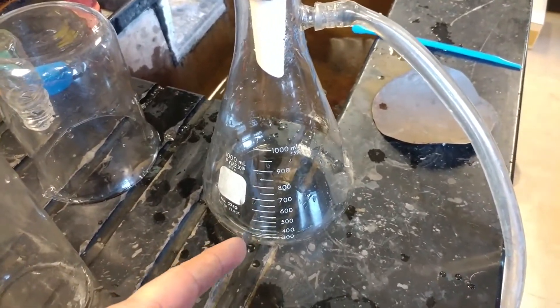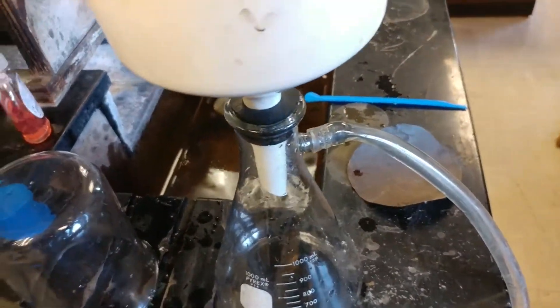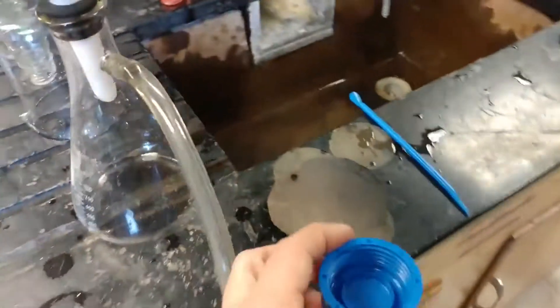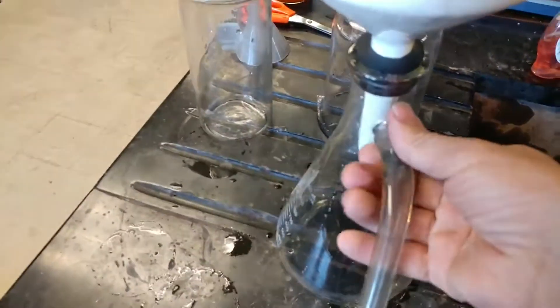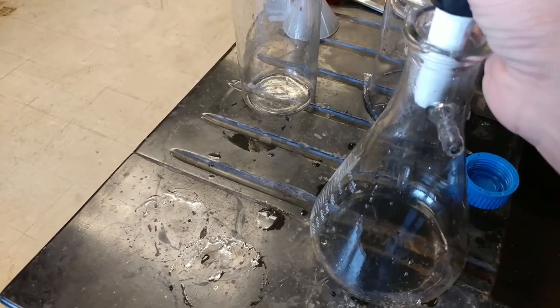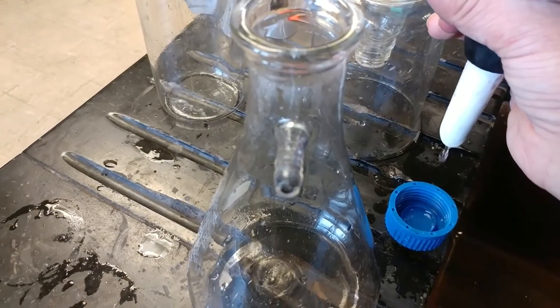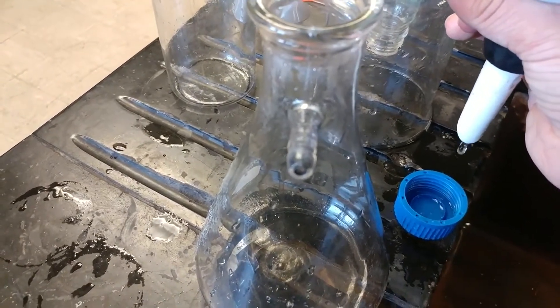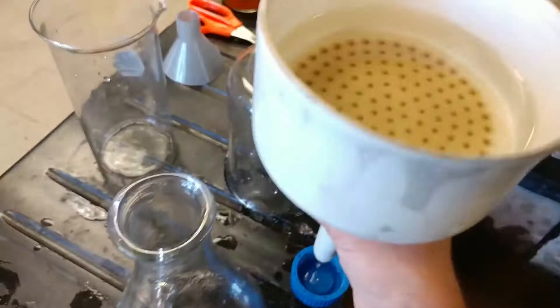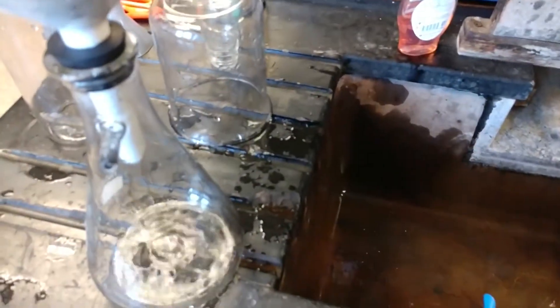Why don't we just do our miniature shot glass of goodness, which will be this Fisher brand cap. And maybe we can pour it in there. Okay, so here we go. We can get the Kraken — actually, we got quite a bit. It's kinda pouring out now.